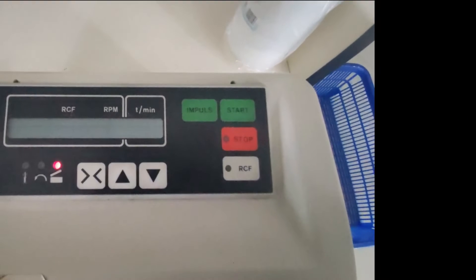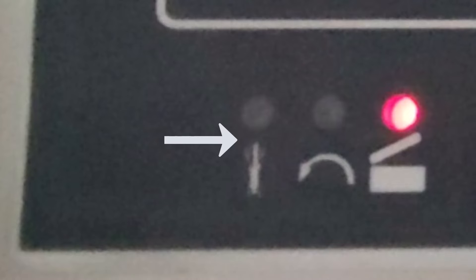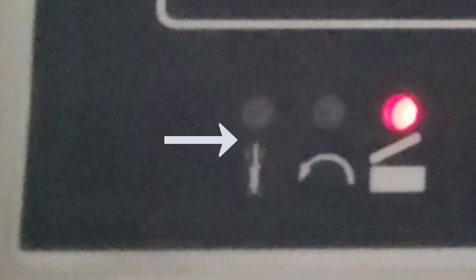There are three indicators, each with an LED symbol. The first one is the balance error indicator — if this LED is lit, the rotor must be loaded evenly. The second is the rotation indicator — if this rotation indicator is lit after the start, it remains lit until the rotor comes to rest.